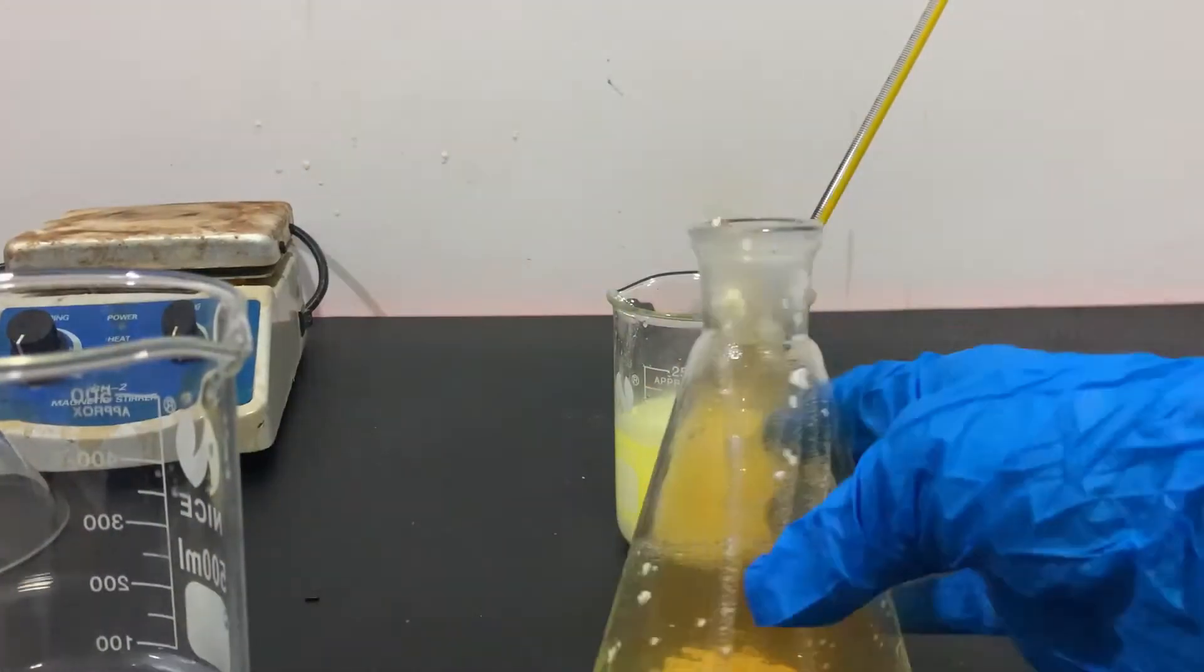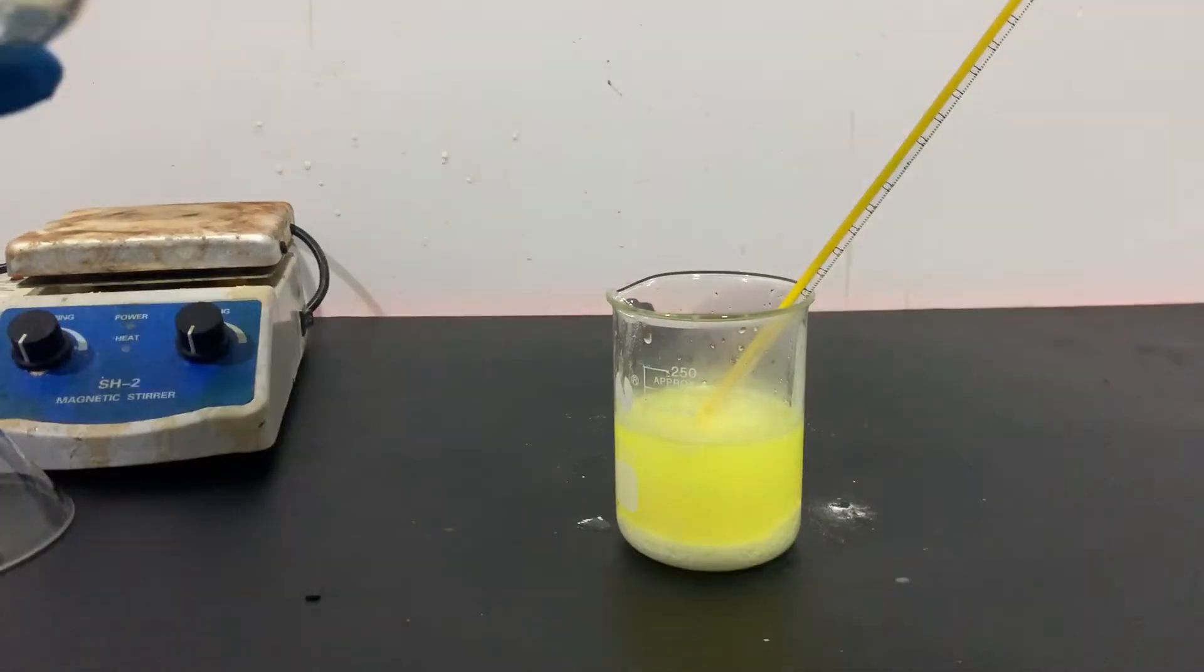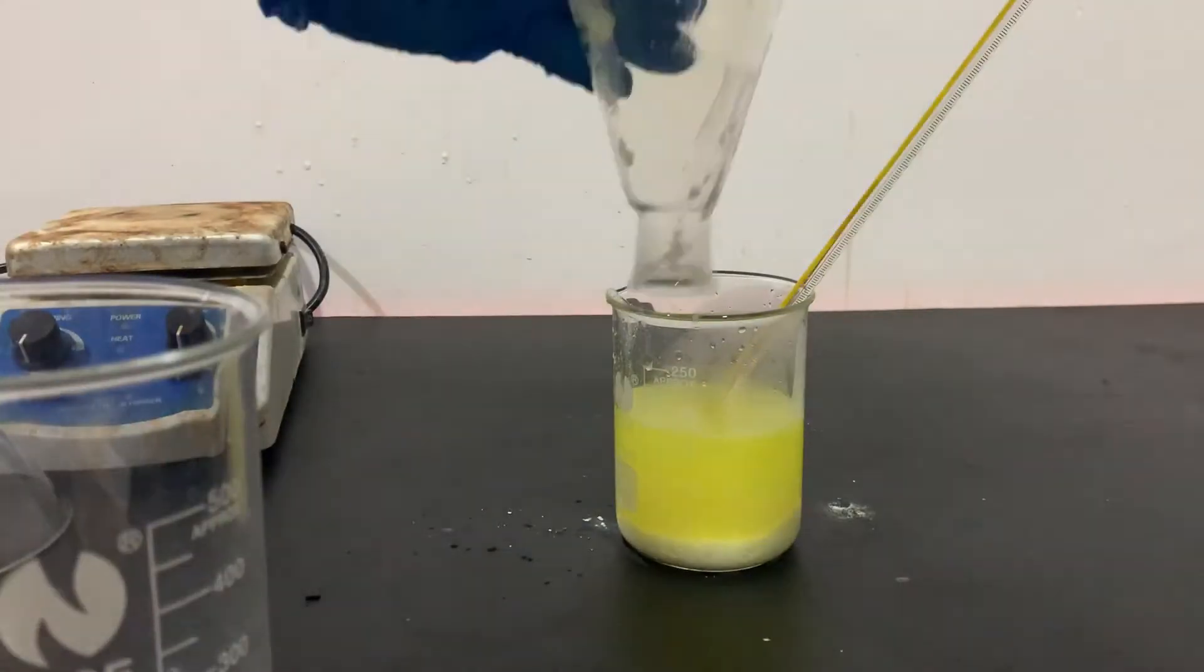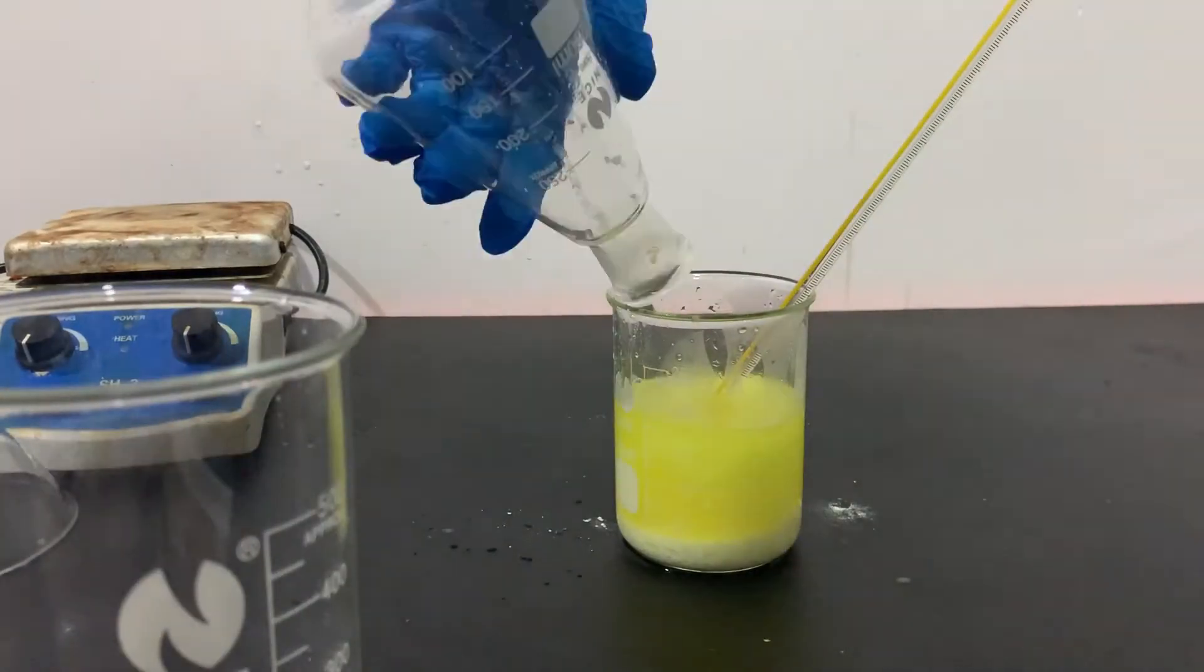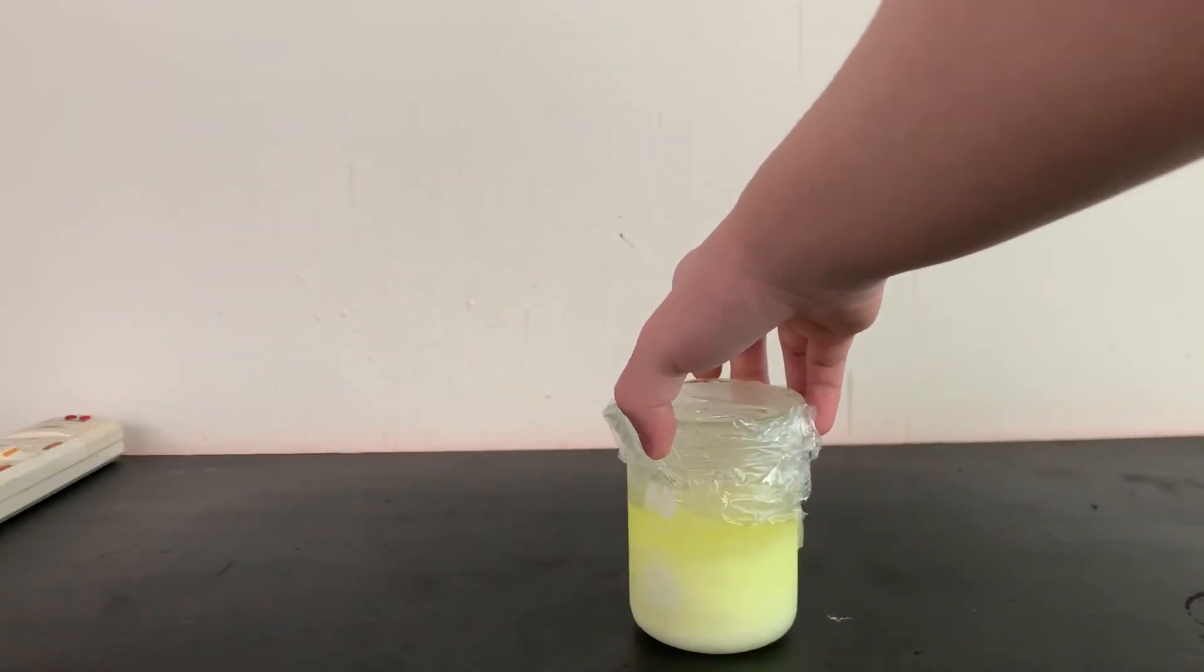The flask was then washed with a bit of water to get out as much of the reaction mixture. The beaker containing our product is then cooled in the fridge overnight.